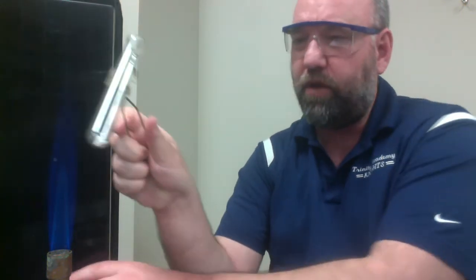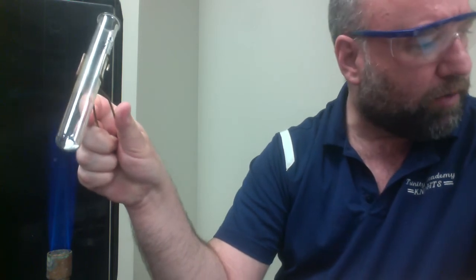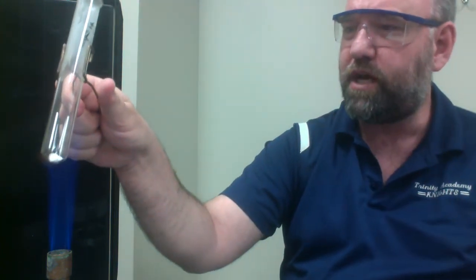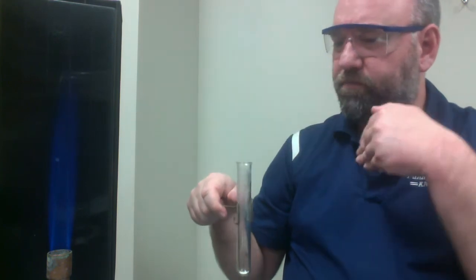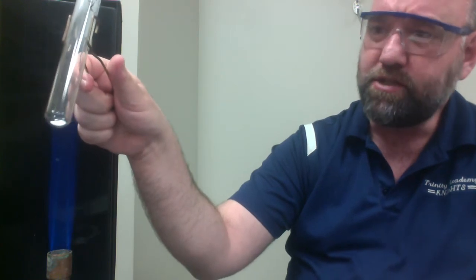So what we do on this one is we heat this over our Bunsen burner flame for approximately 10 to 15 seconds. And then after 10 to 15 seconds, I'm going to waft the fumes towards my nose. Remember, wafting, we want to pull the fumes towards us. We do not want to stick our nose directly over this test tube. So, we go like this. And if I don't smell it yet, I'm going to continue to heat for another 10 seconds.